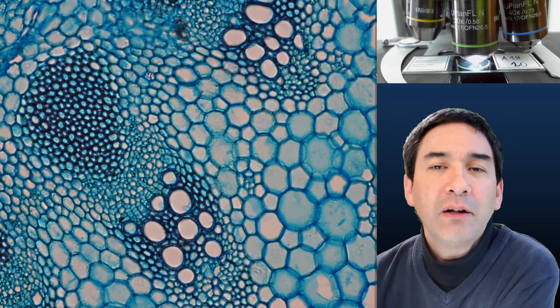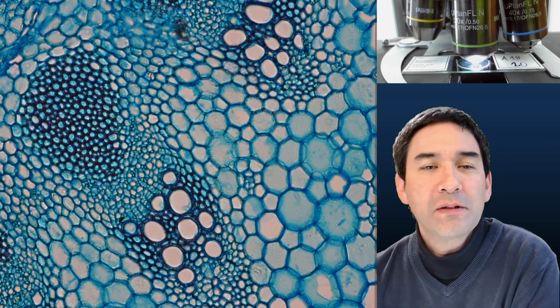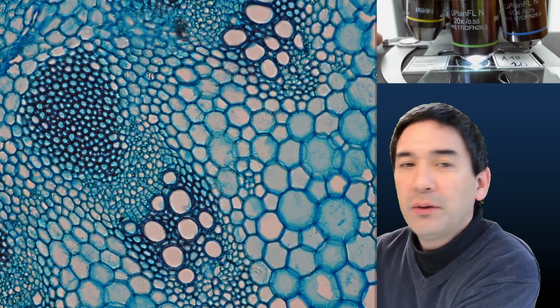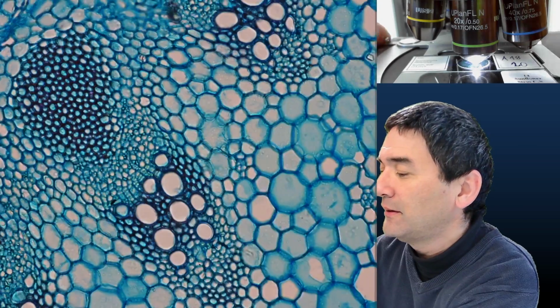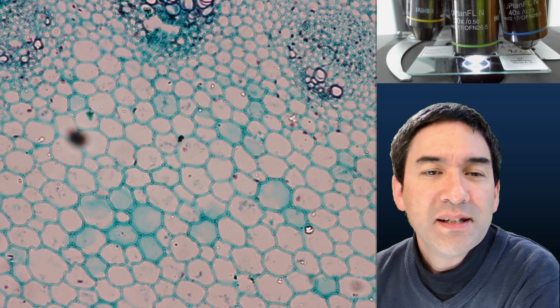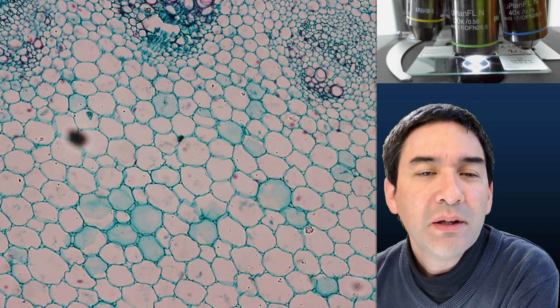Okay, so now let's put in the cheap microscope slide for a comparison. And so I'm going to put in the other one over here right next to it. Okay, and let's move over. Yeah, and this here is now the 40 cent microscope slide. Here too, we can focus a little bit.